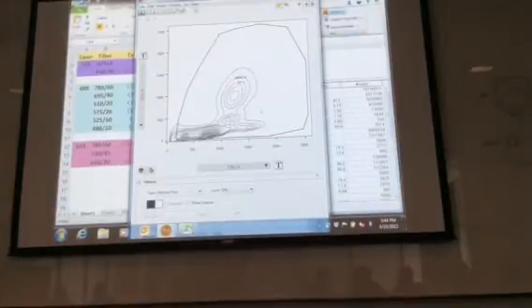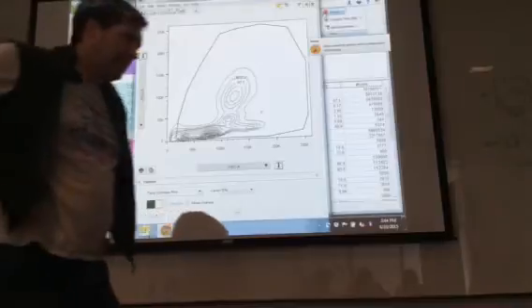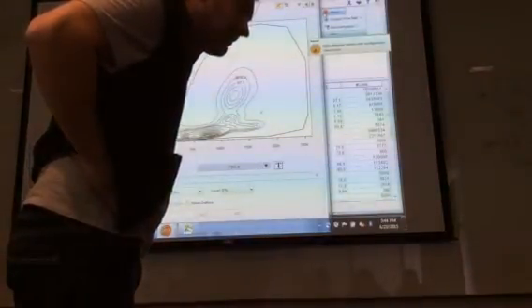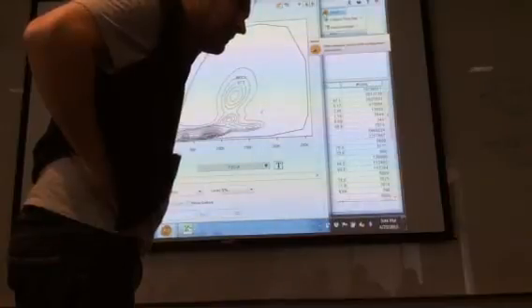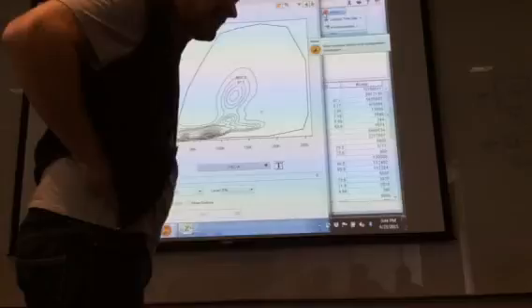And why is the compensation underneath clear and doesn't have a word until I click on it? Is it just the color? Yeah, it's a clear color. I don't know, you might need to just adjust it.